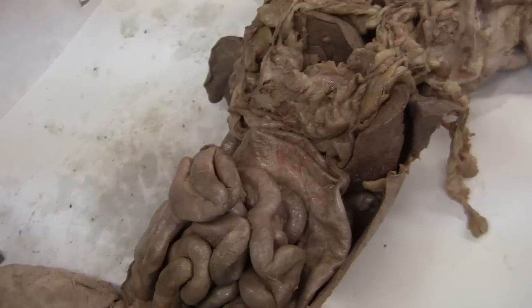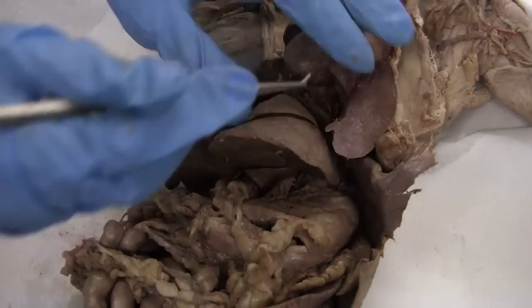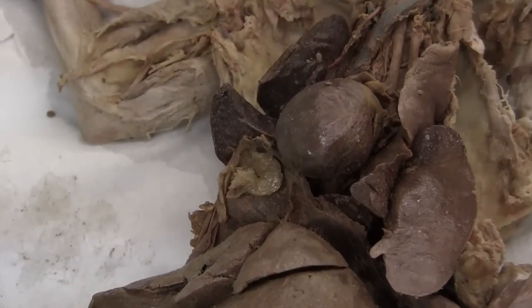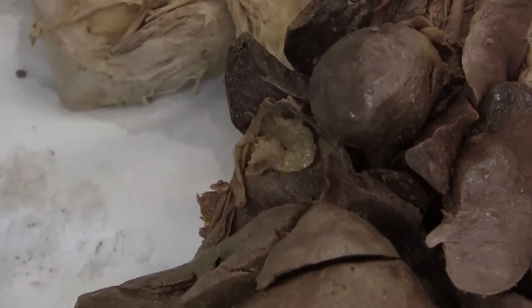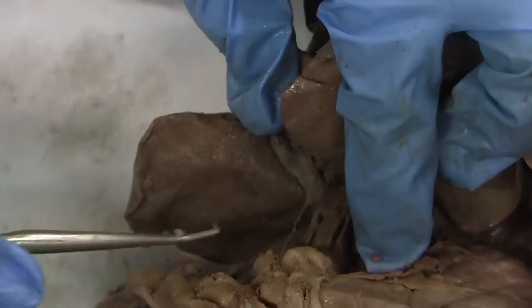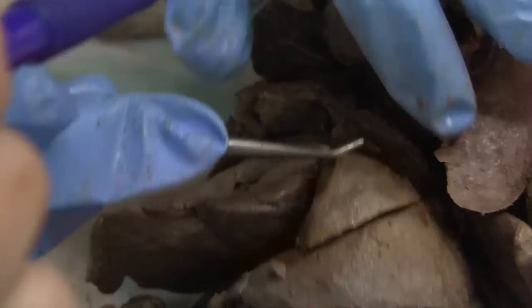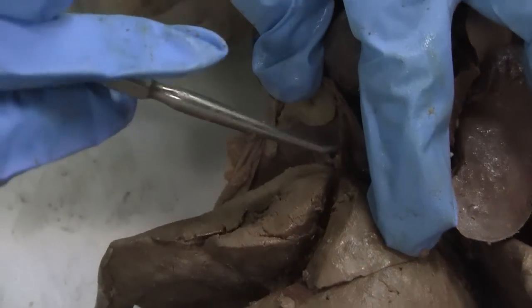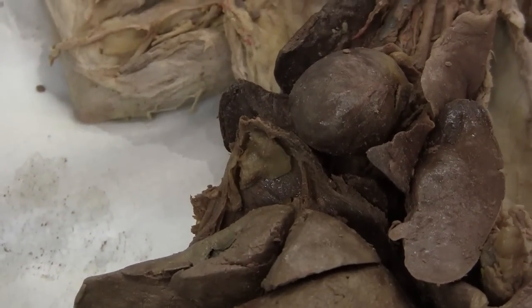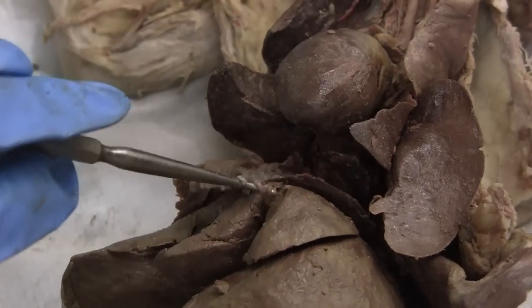What about the falciform ligament? The falciform ligament is this — here. It connects the liver to the diaphragm and the front of the cavity. This is above the liver. And can you see the round ligament, or the ligamentum teres? I don't think you can see it in here — it's too small.